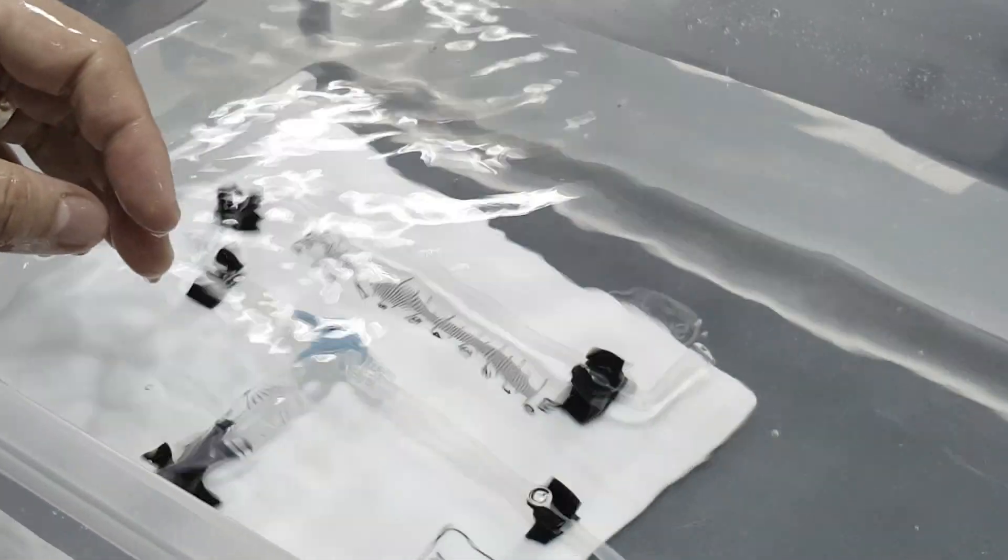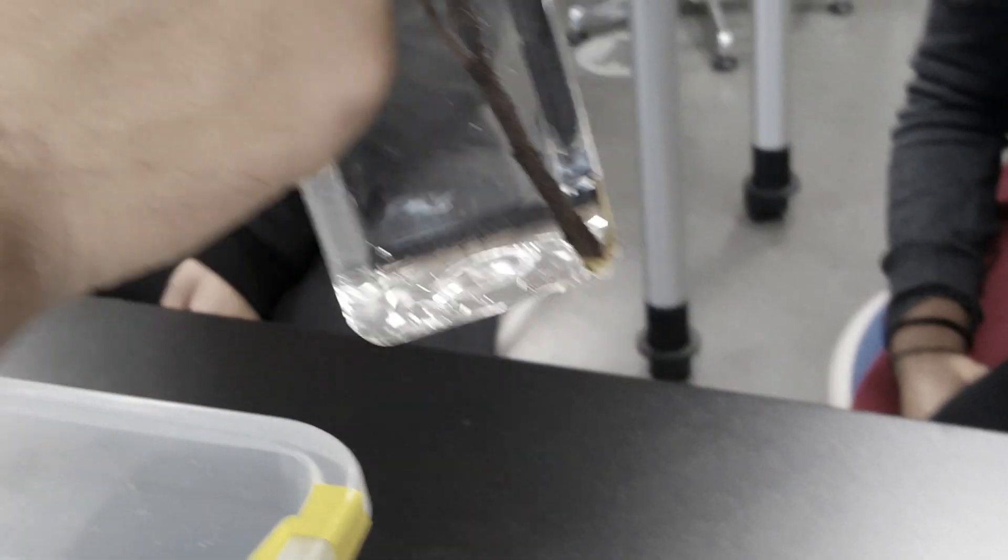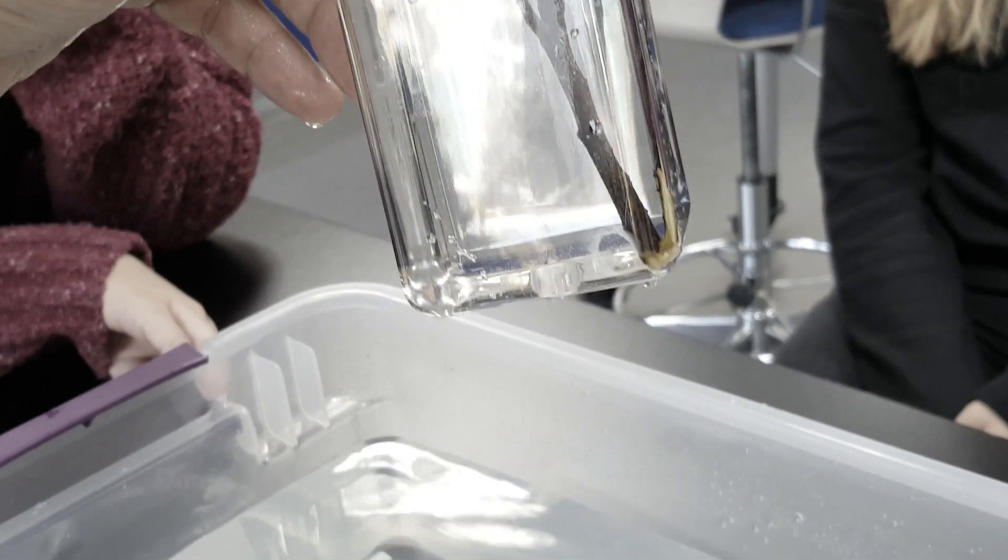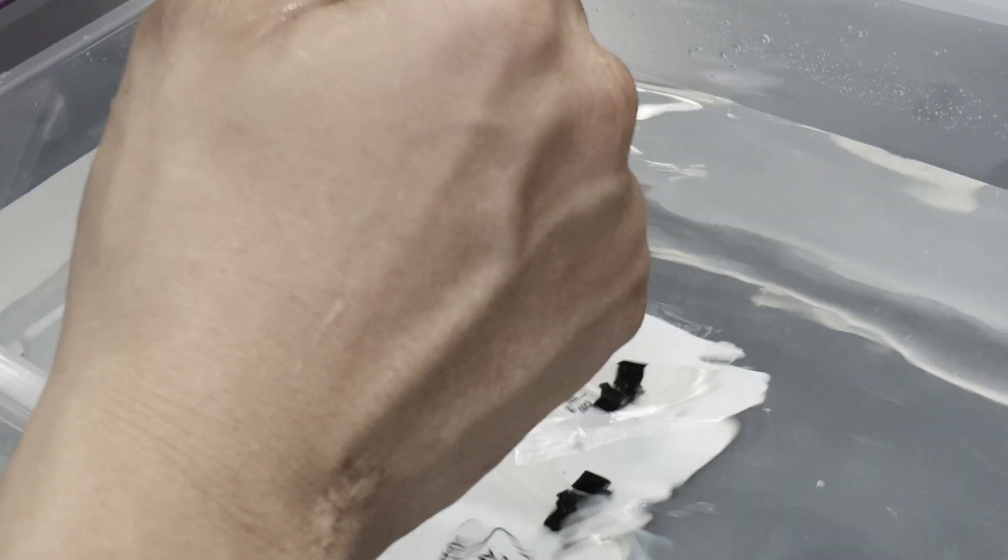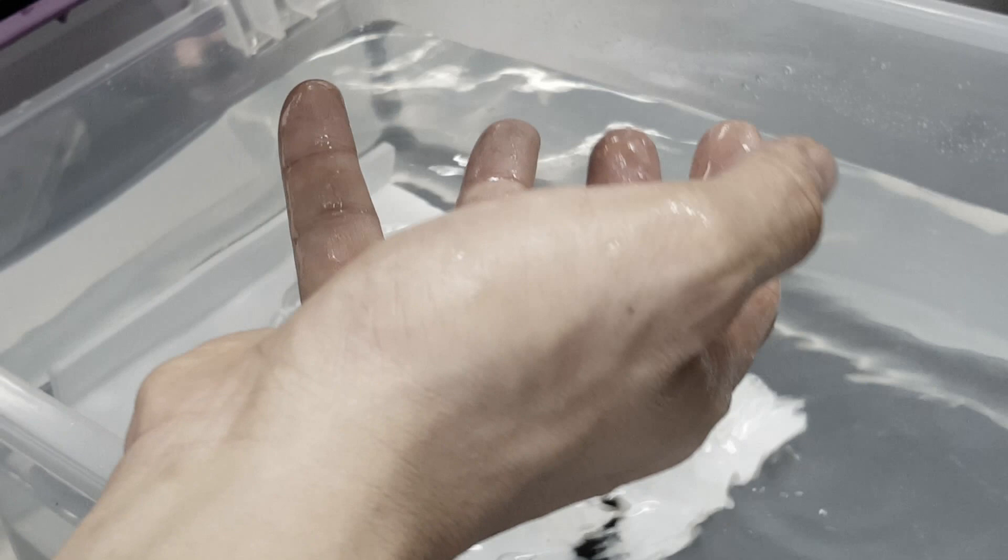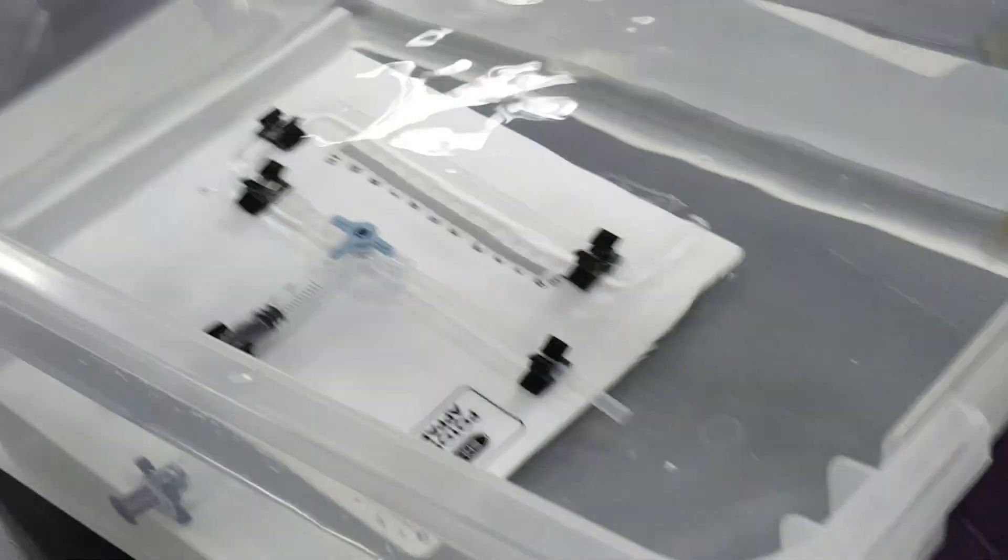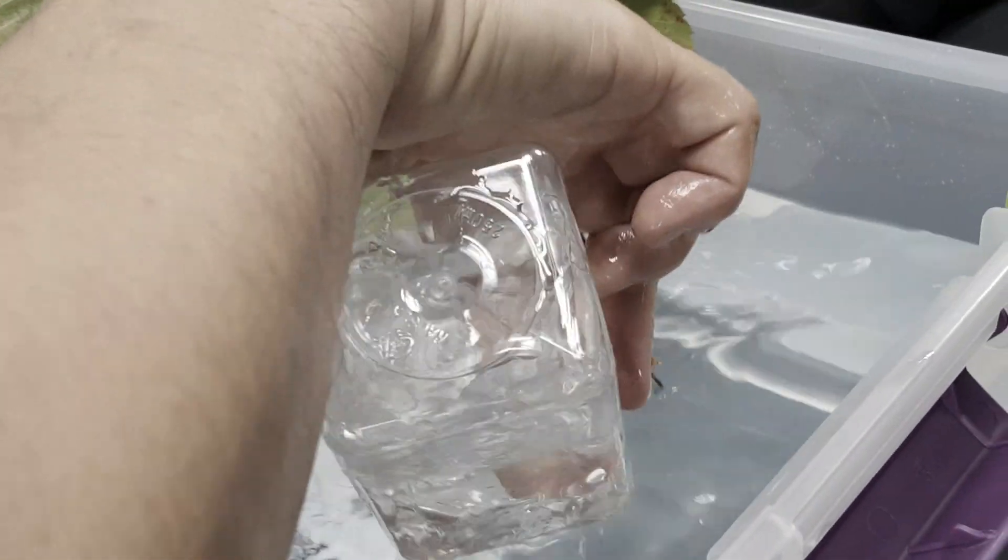Then you take your plant. Now, your plant, as I said before, needs to have a stem that's thick enough so it fits in there without air being formed. It also needs to be alive. So you take the plant out as quickly as you can, make sure it stays wet, keep some of the water.